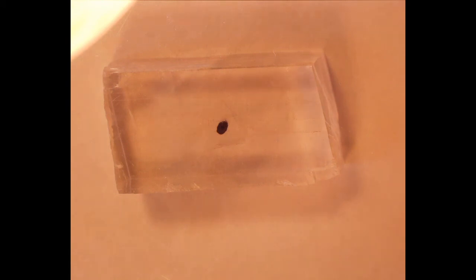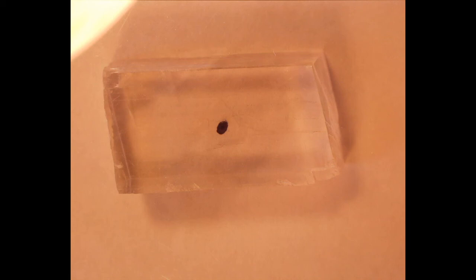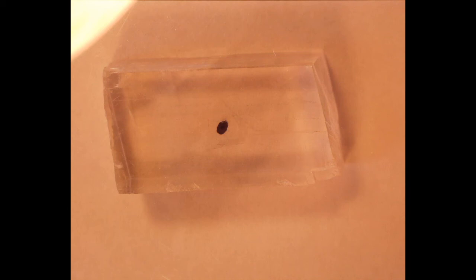So when light enters an anisotropic material it is split into two beams polarized perpendicular to one another. Let's update the experiment using our tablet polariscope. When using the polariscope we rotate the mineral in either plane or cross polarized light. It's important to note that in order to have the plane polarized light vibrating in the north-south direction, the tablet had to be oriented sideways. Devices can be polarized north-south or east-west, so you need to know that orientation — or remember that everything might be off by 90 degrees.